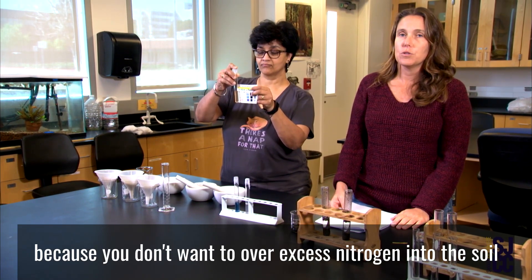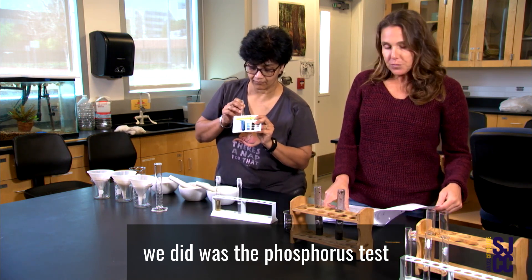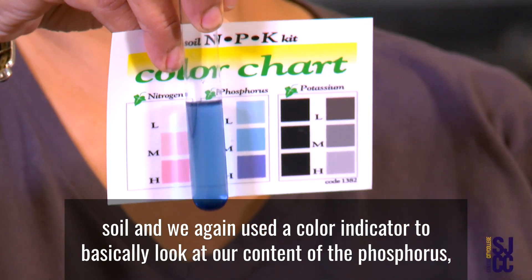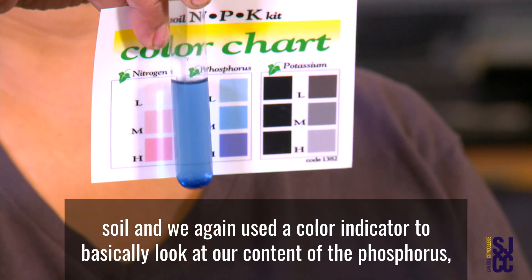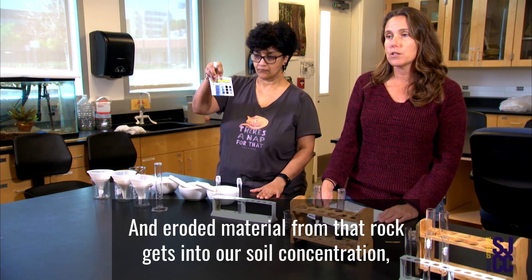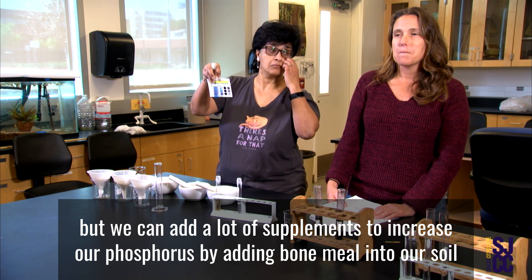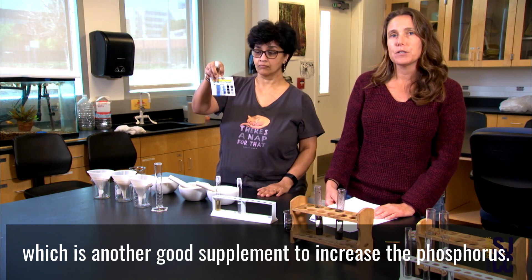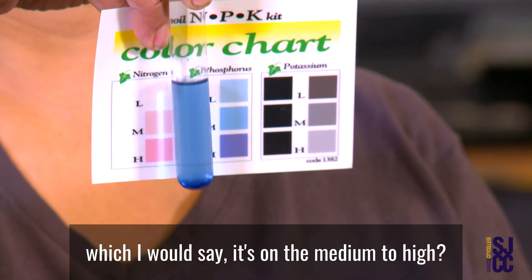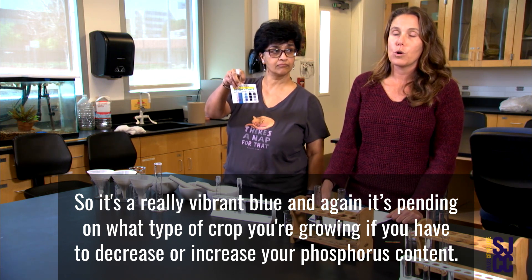The next test we did was the phosphorus test. We extracted phosphorus from the soil and used a color indicator to assess its concentration. Phosphorus is usually amended by rock material — eroded material from rock gets into the soil. We can add supplements to increase phosphorus, such as bone meal, which is a good supplement for this. As you can see, we have a deep, rich blue, which I would say is on the medium to high side — a really vibrant blue. Depending on the crop you're growing, you may need to decrease or increase your phosphorus content.